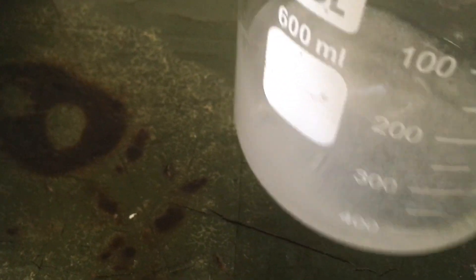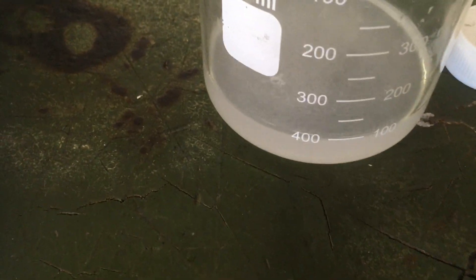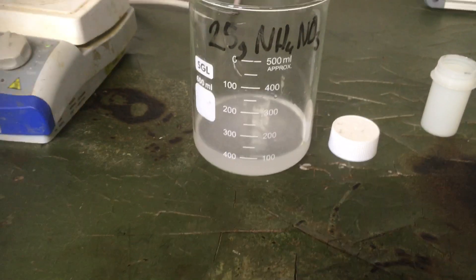That's all the potassium hydroxide in there. I'm just going to leave that to react for a bit and occasionally stir it, then I'll heat it down and it should be done. You can definitely smell the ammonia that's coming out of it.